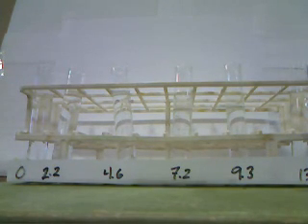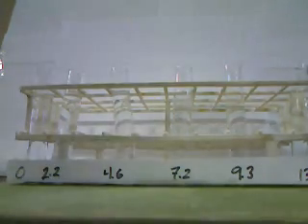We're now going to see what the indicator methyl red looks like in each of our 6 solutions.